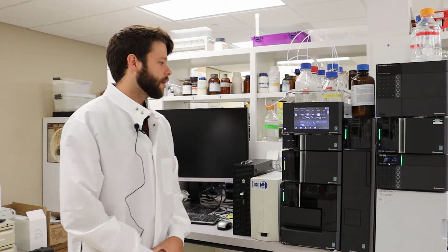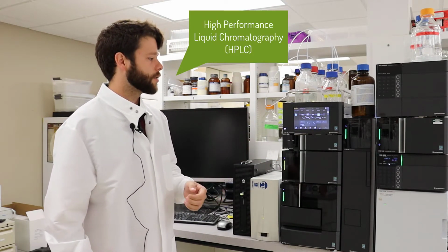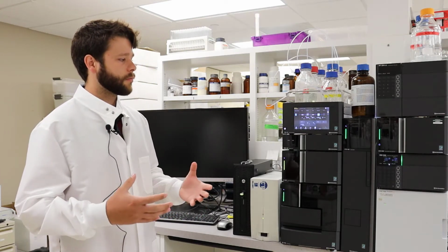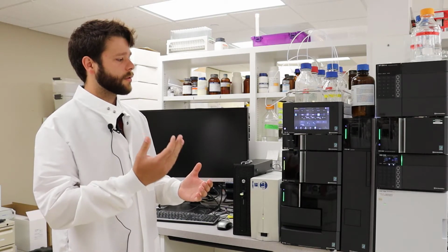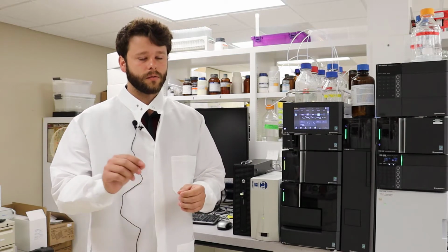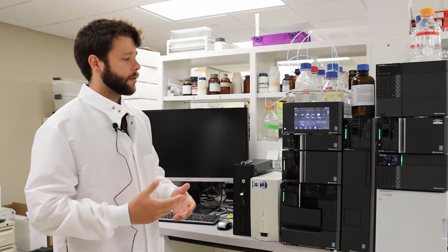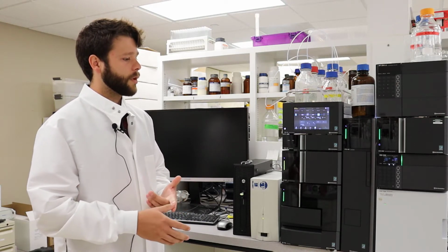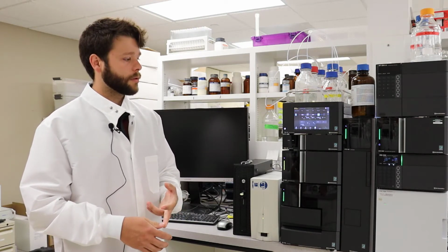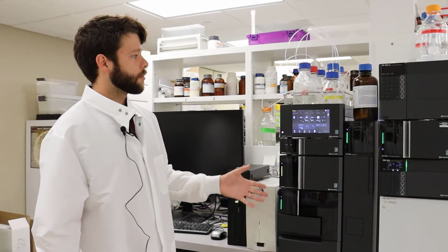Here is an HPLC, as you'll commonly hear it referred to, or high performance liquid chromatography. What this machine does is it runs a solvent through a column at a very high pressure, and that separates out individual chemicals. You can use this machine for a variety of reasons. We primarily use it to measure the concentration of drugs, but you can also use it to measure purity and actually purify drugs themselves. So over here, we're just going to go through the hardware right now.